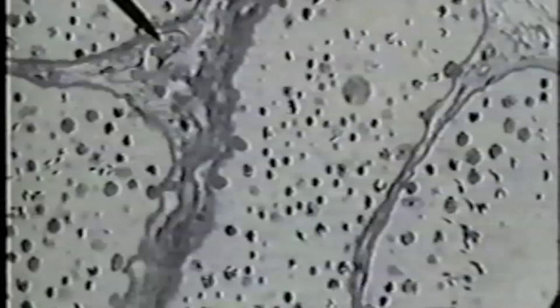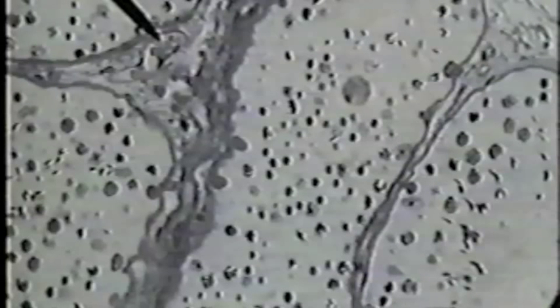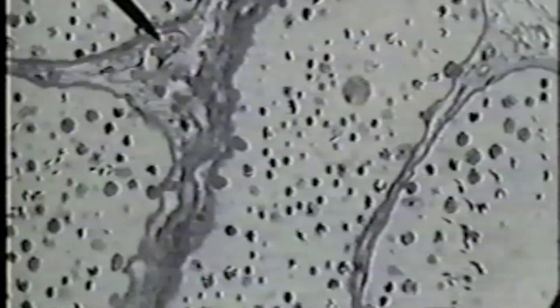This connective tissue layer around the outside of the whole testis is the tunica albuginea. A septum is seen to the right. This cluster of cells found in between the seminiferous tubules are the cells of Leydig.